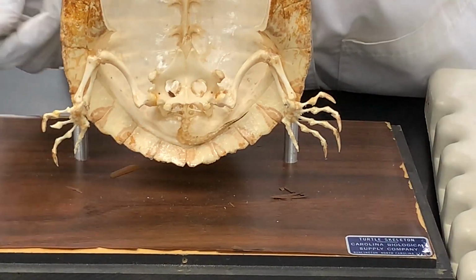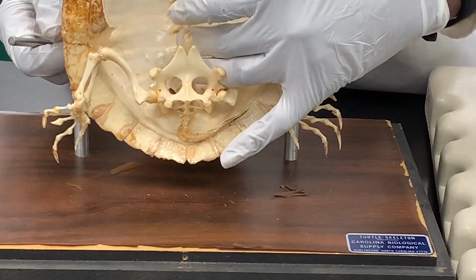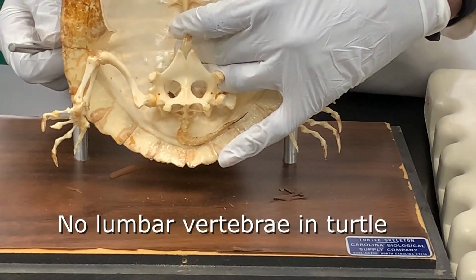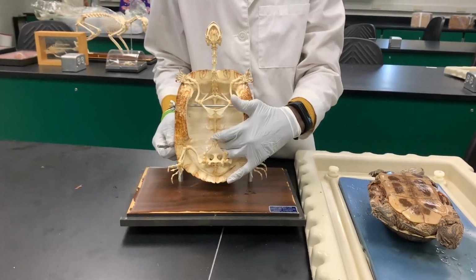So those are the vertebral column. One thing that you need to note is that we didn't mention the lumbar vertebrae in the turtle, which is different from when we start to talk about humans and the cat. They have the lumbar vertebrae.